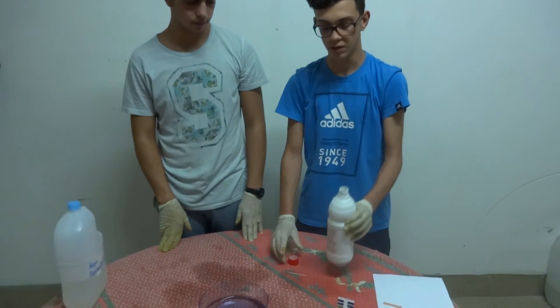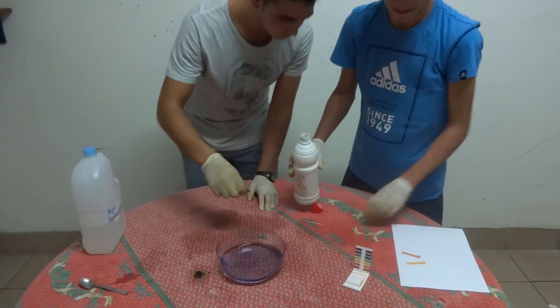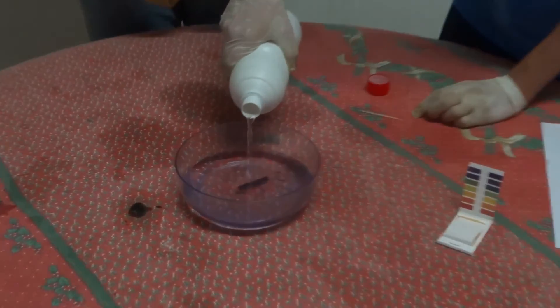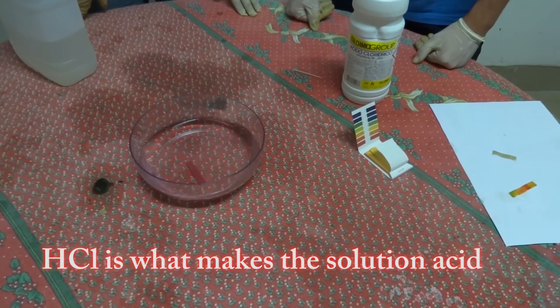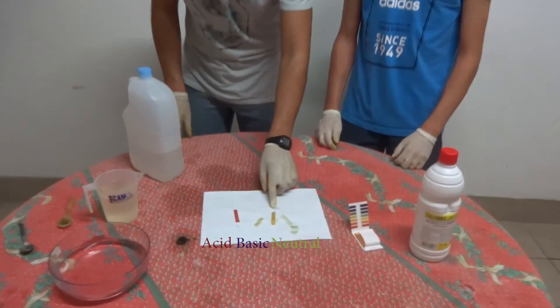If we put the acid inside the jar, it turns color. And now we can see the red color typical of an acid solution. Now the experiment is finally over and we can see the indicator papers showing an acid solution, a basic solution, and a neutral solution.